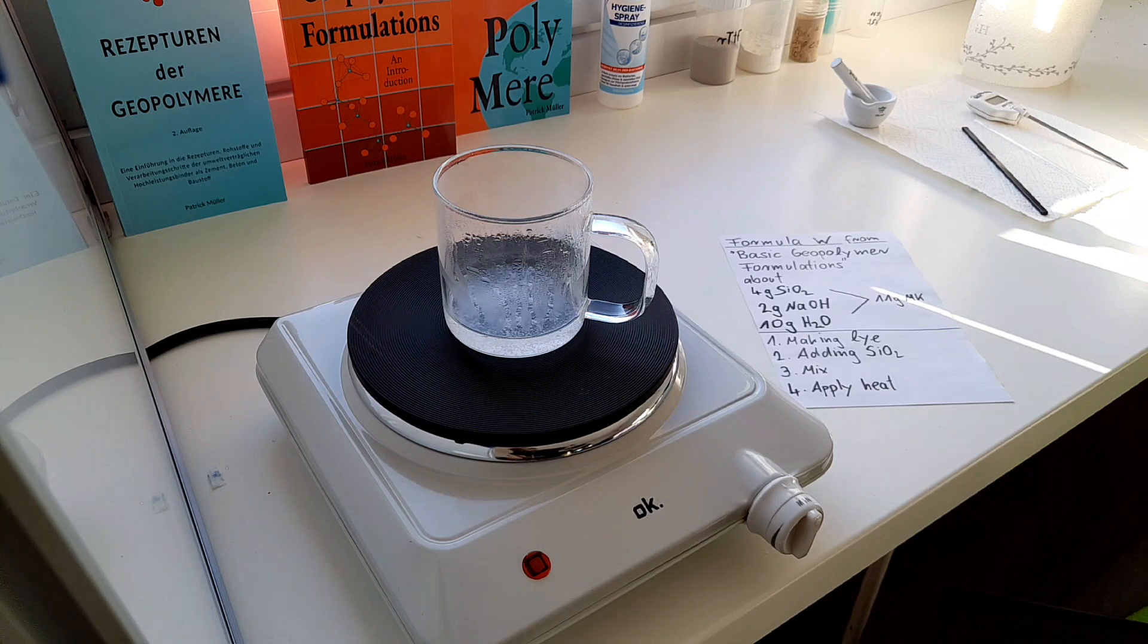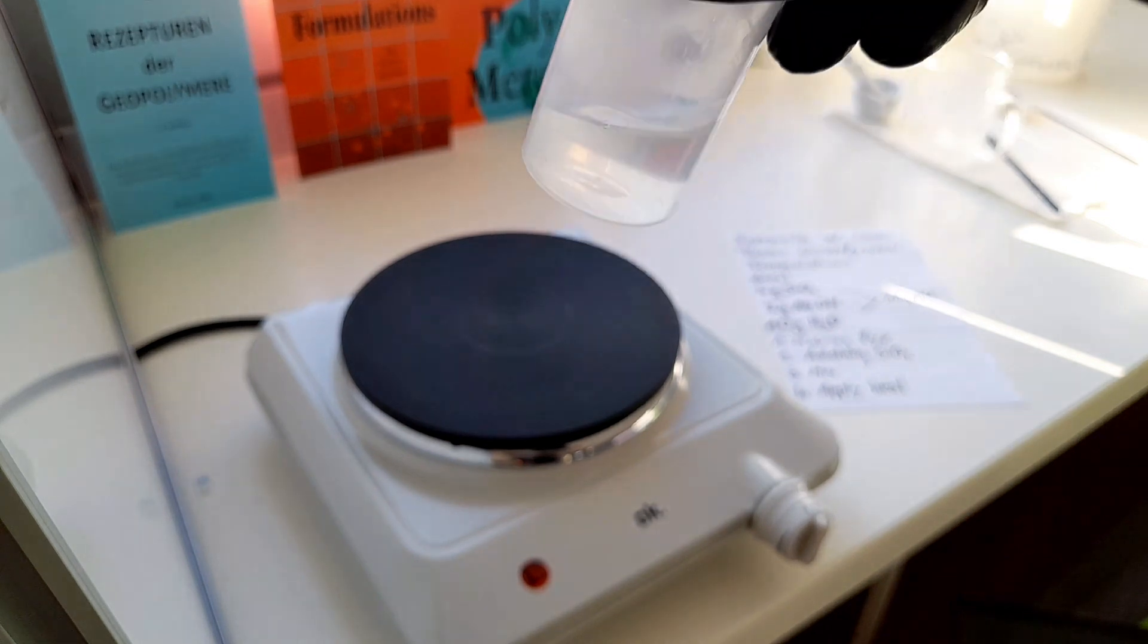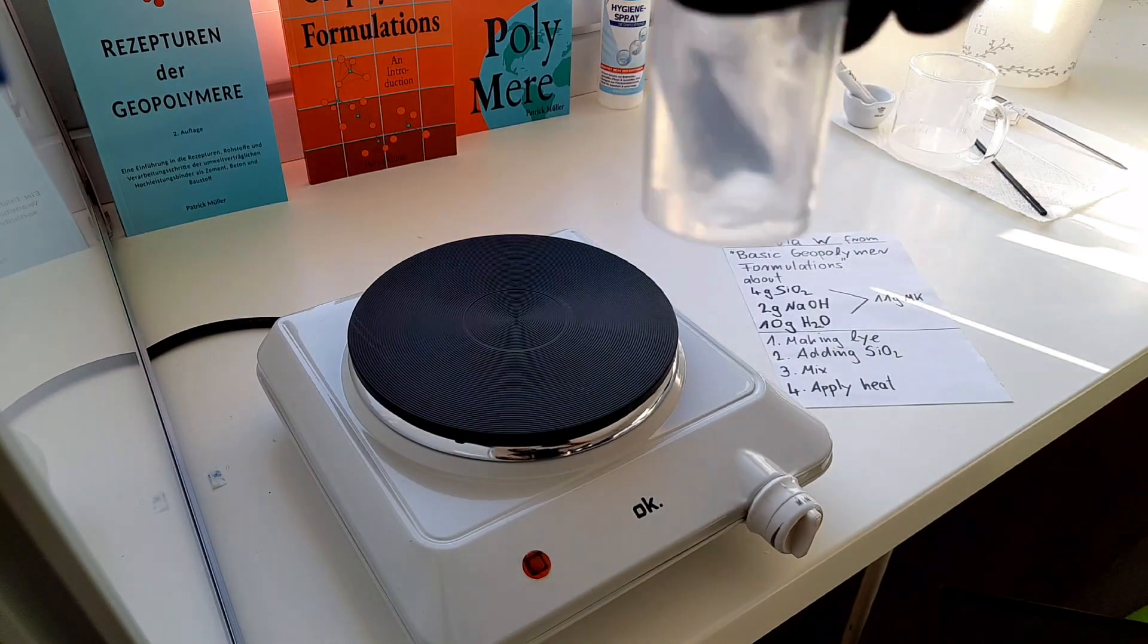So after our second boil, I can't see any silica beads remaining. It worked out quite good.